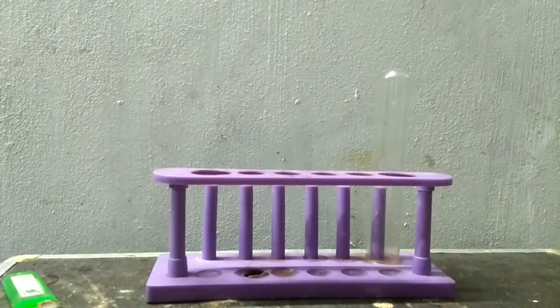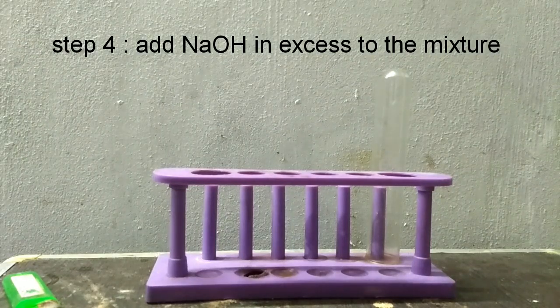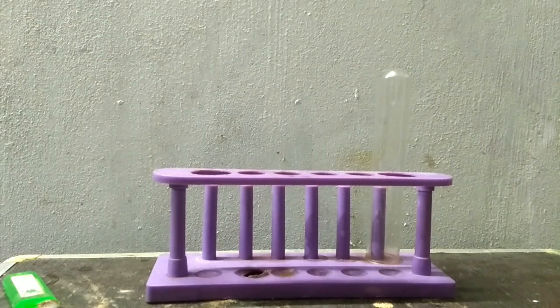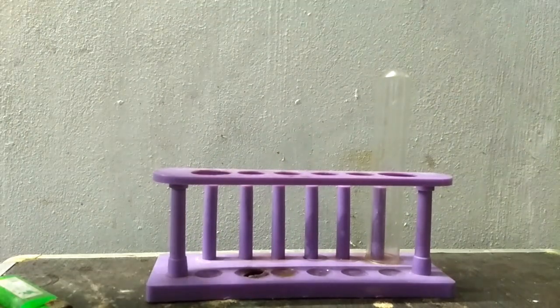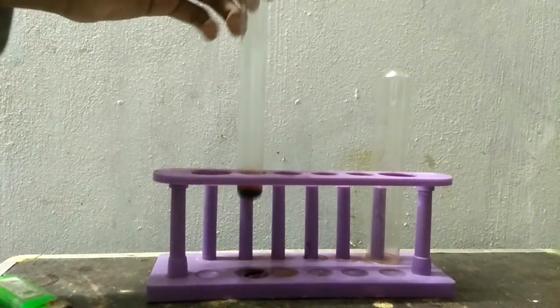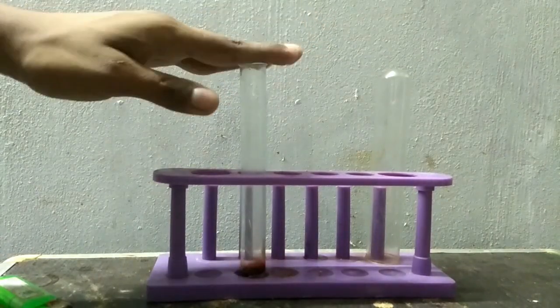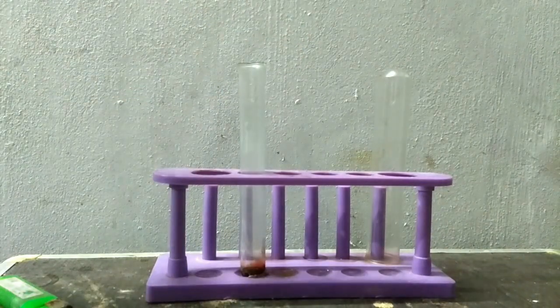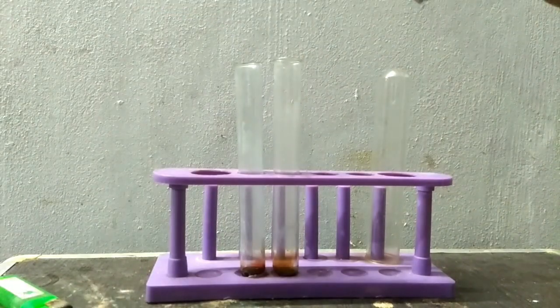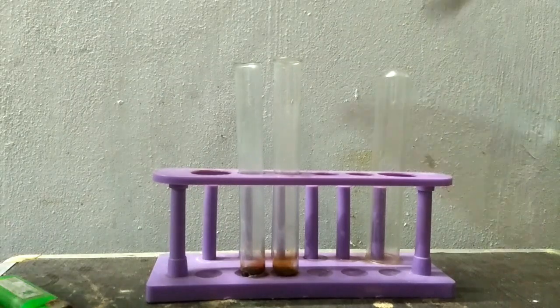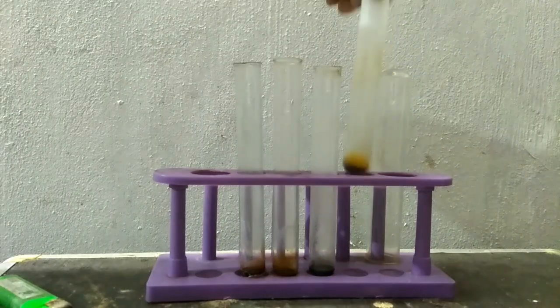We keep it aside to cool. And now we come to the second step. This is prepared from hydroquinone. This is the alpha naphthol one, and some dyes I have prepared from before. This is beta naphthol and this is salicylic acid.